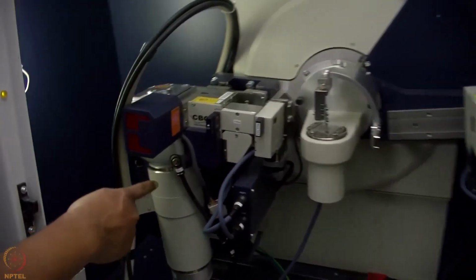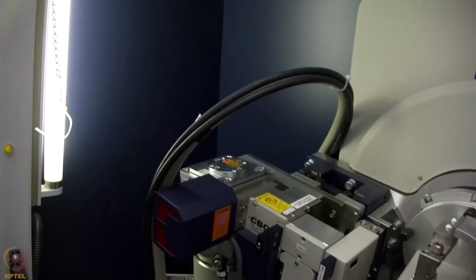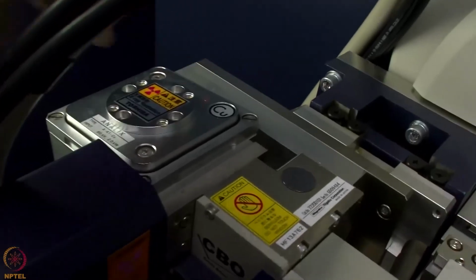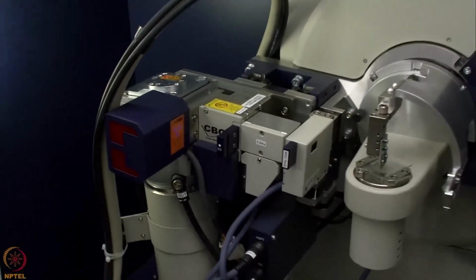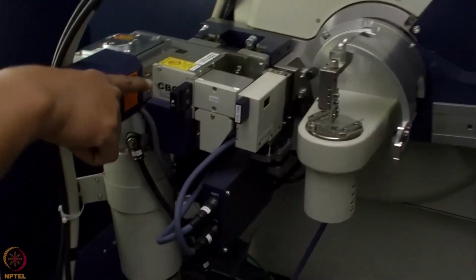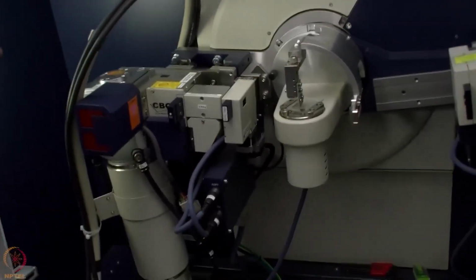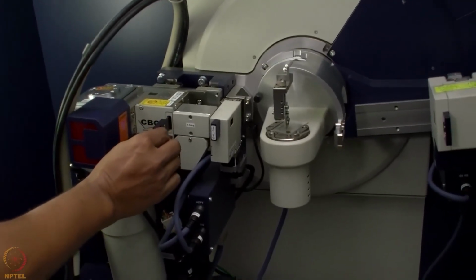On the left hand side here we have the X-ray tube mounted. This is mounted from top, and you can probably see that this is a copper based X-ray source, which is written here as copper. So the tube is giving you copper K alpha and K beta radiation out of it. So when the beam comes out, this is the optics, which is called the cross beam optics. It then makes the beam in a linear fashion, and then we have some slits here.